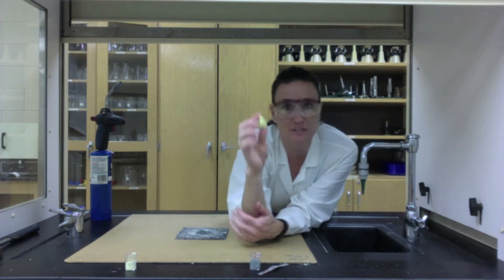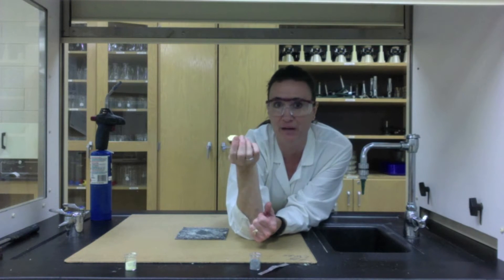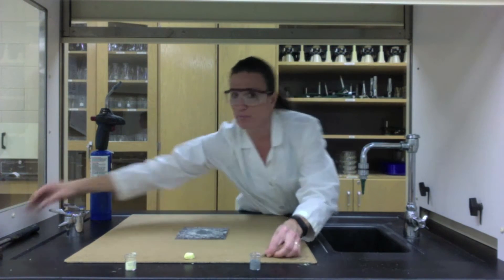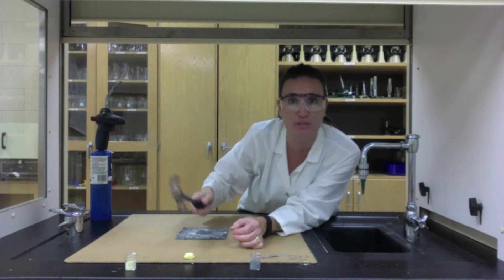The element sulfur is a non-metal, so it's non-malleable. It doesn't conduct electricity or heat, and non-metals are typically not gray. In this case, sulfur is yellow. To prove that it's not malleable, it's actually the opposite of malleable, which is brittle.